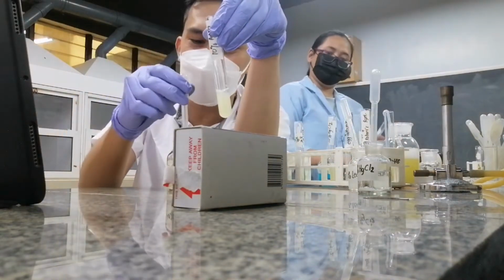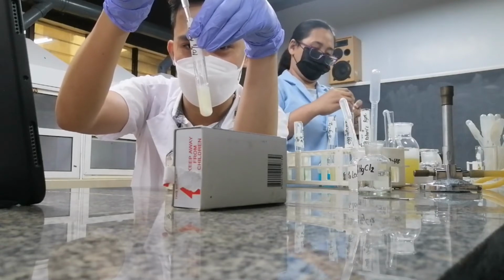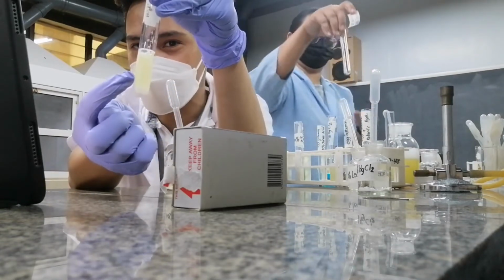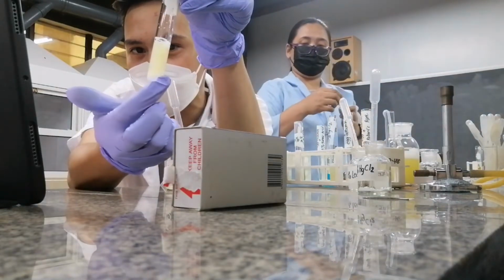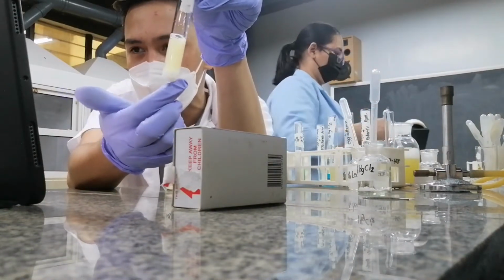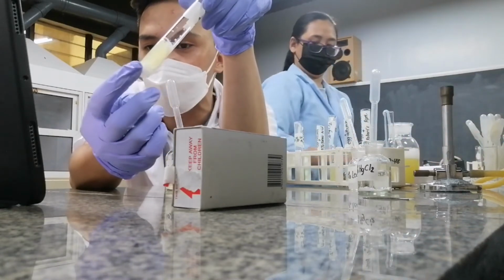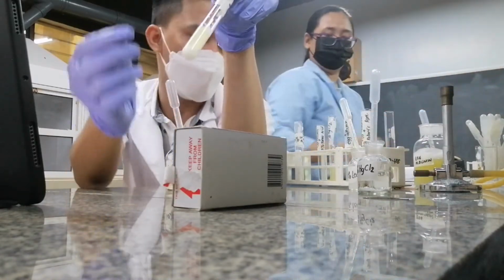Let's see if it's really a precipitate. Try to look at it. As you could see, there are solids that separated from the solution, meaning to say it's a precipitate. How do you characterize the color of silver nitrate precipitate with protein? That's actually white. Okay, white precipitate. Very good.